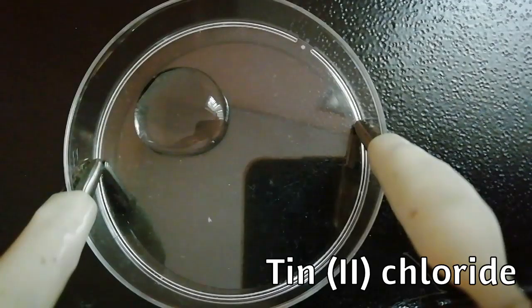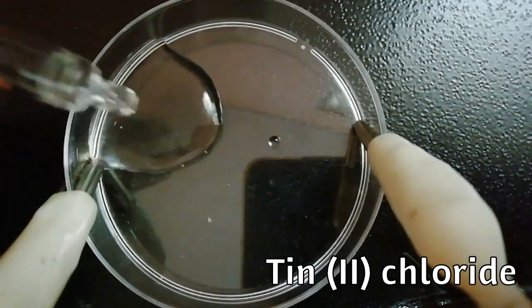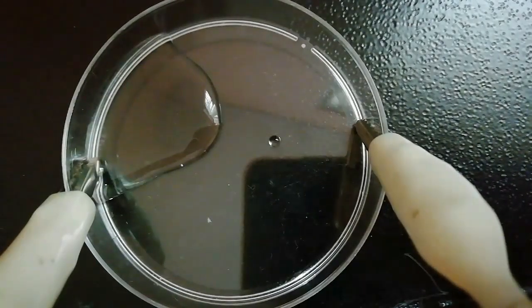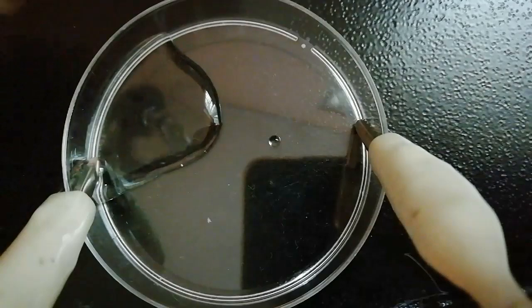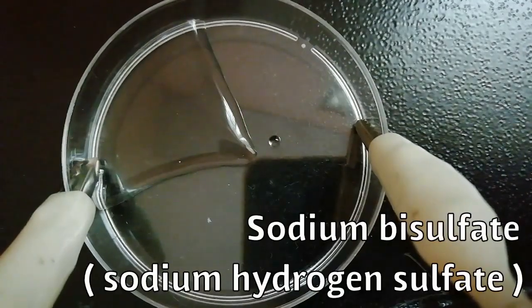Then tin(II) chloride solution is added. Next, sodium bisulfate solution, also known as sodium hydrogen sulfate.